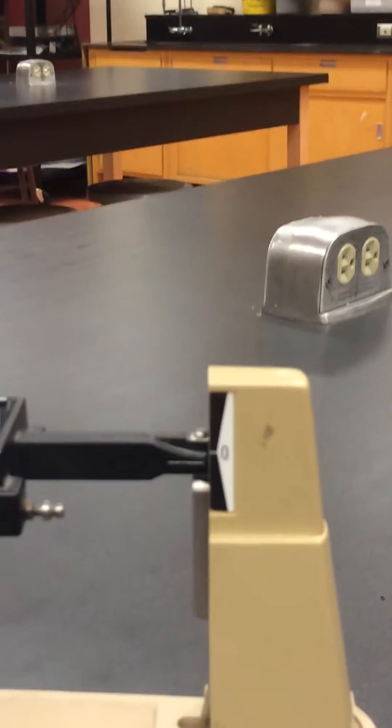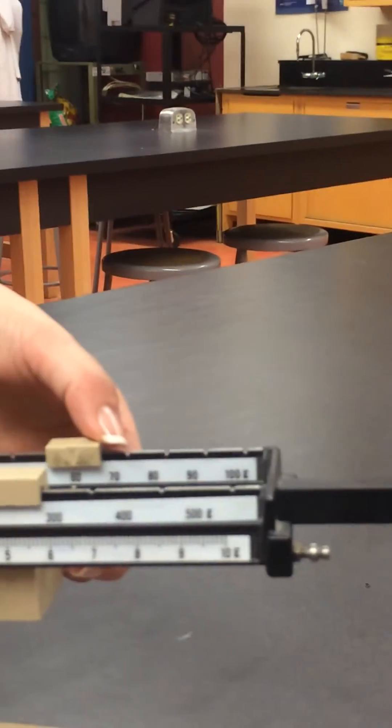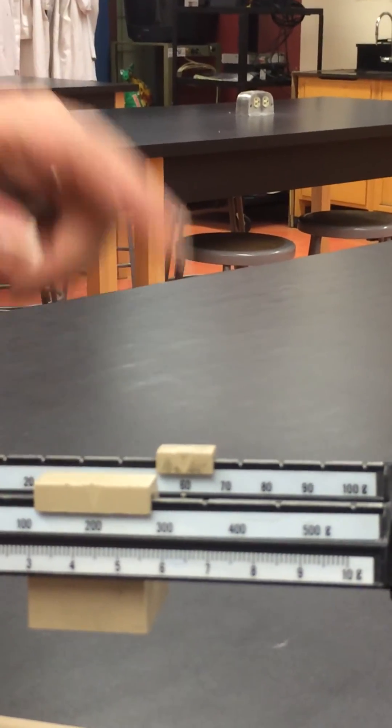That means you have to back up one. So that means the mass of this object is 260 something.